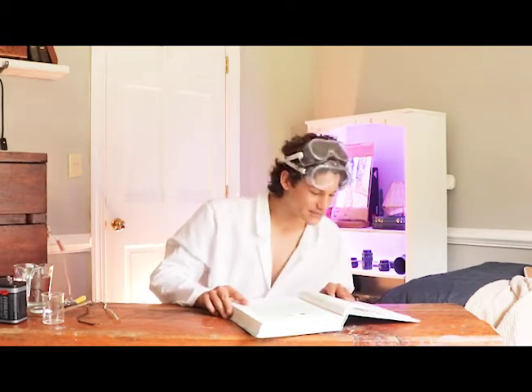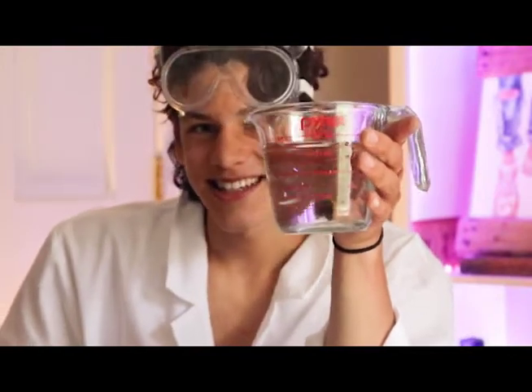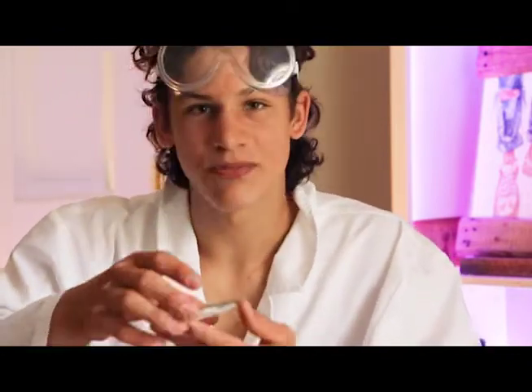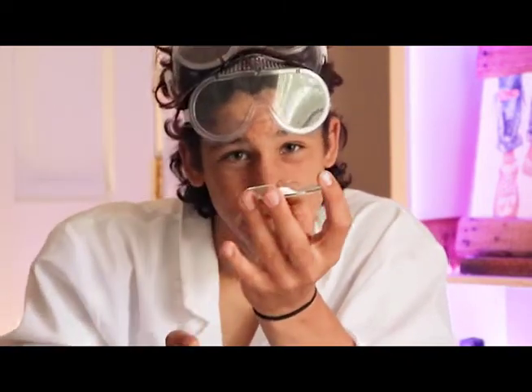To get started, you're going to need some supplies. First, you're going to need distilled water. This might look like just normal water, but believe me, it's distilled. And that's pretty important to the experiment. The next thing you're going to need is a little bit of baking soda. You can probably find this in your mom's cabinet. I've already measured out half a teaspoon onto this watch glass, because that's how much we're going to be using today.